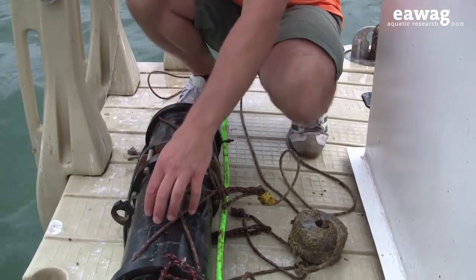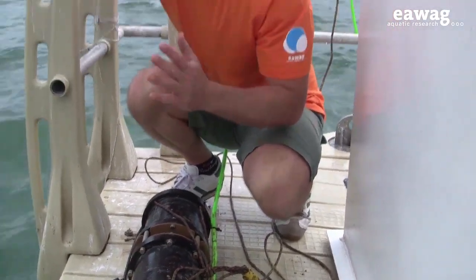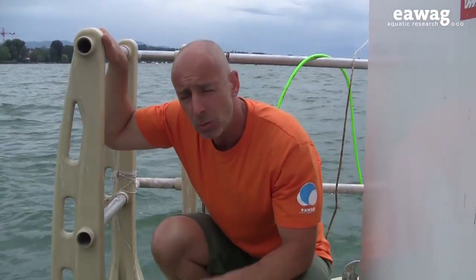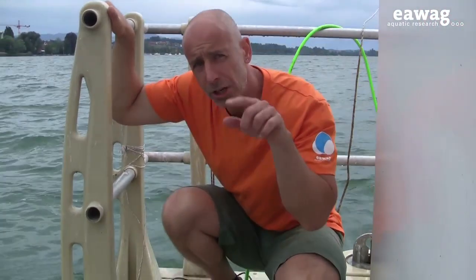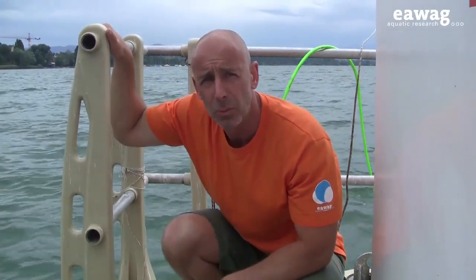and the computer takes a frame every second during day and night, and we capture objects in the frames that correspond to plankton species.